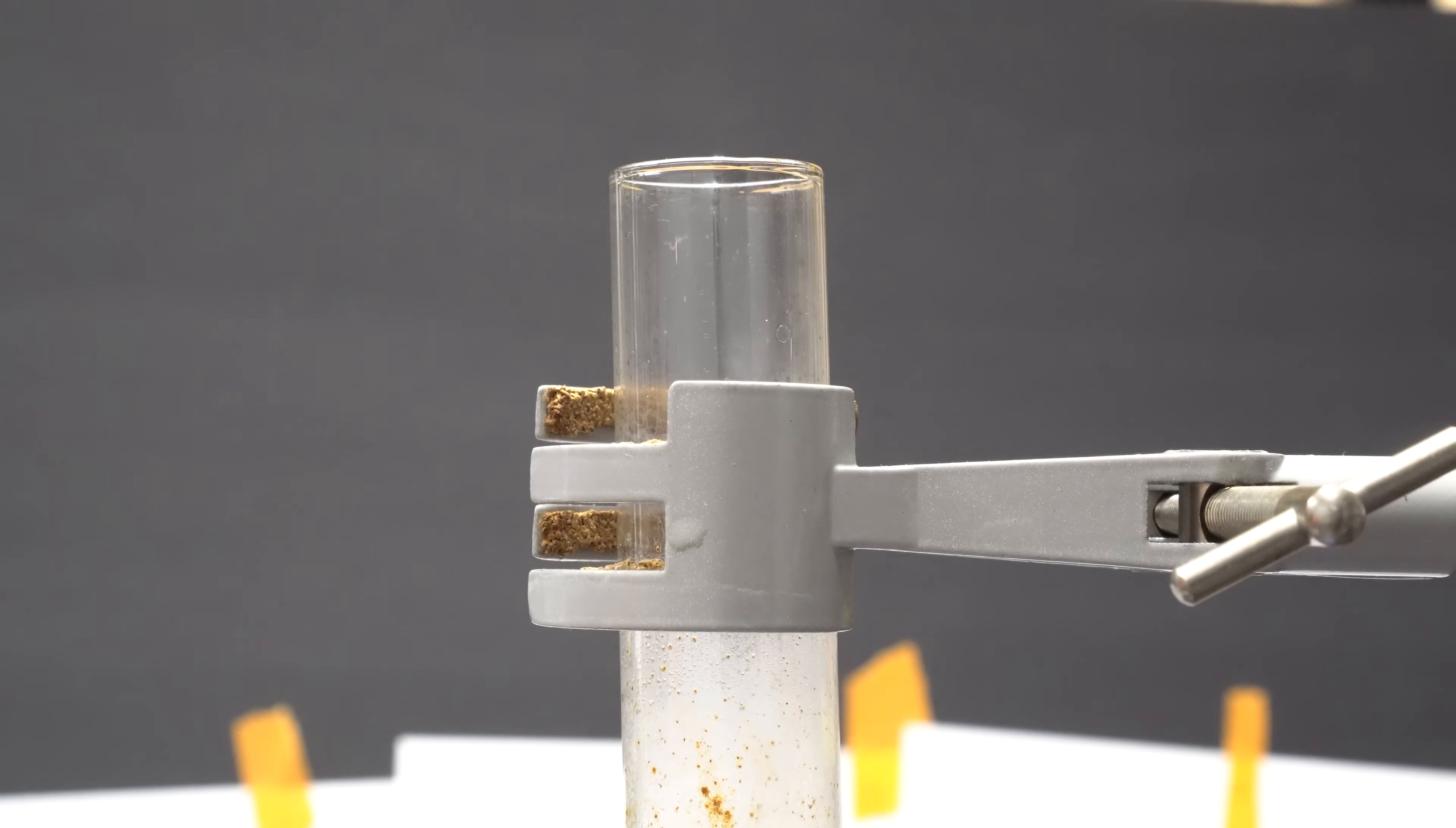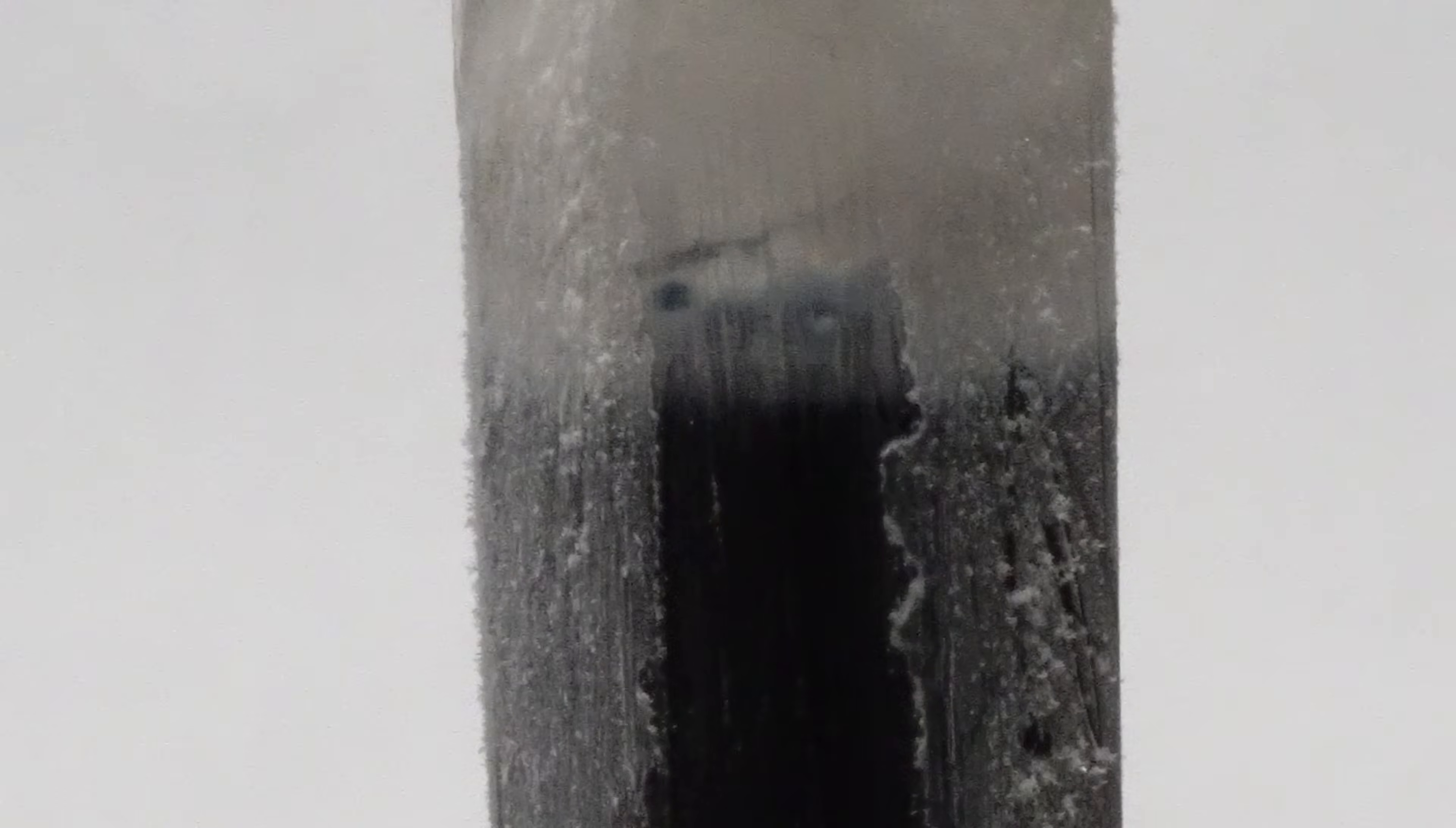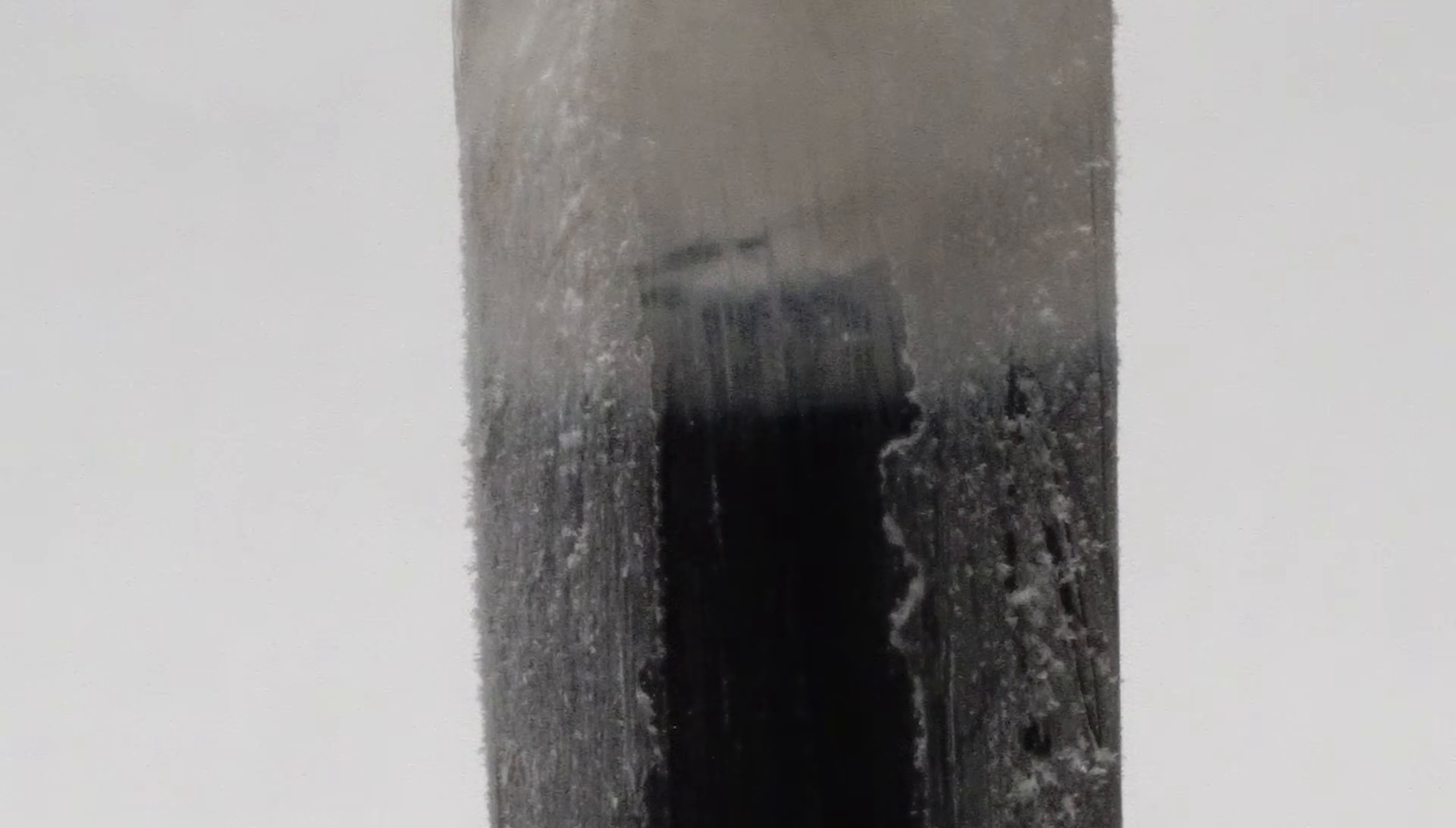I kept adding small pieces of sodium and seeing what happened. I didn't know exactly how much I needed, but I just added until I felt it was right. Any extra sodium should be pretty easy to separate from the sodium amide. After I scraped the sides of the test tube, you can see the boiling ammonia and the beautiful dark blue solution of liquid ammonia with the solvated electrons in there.